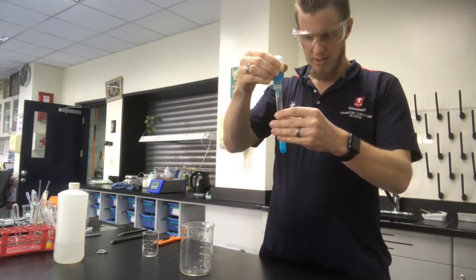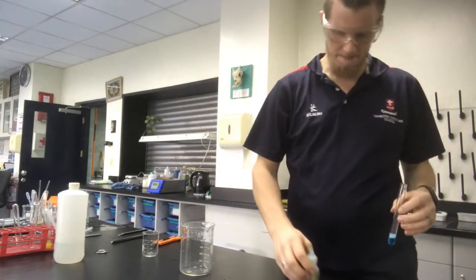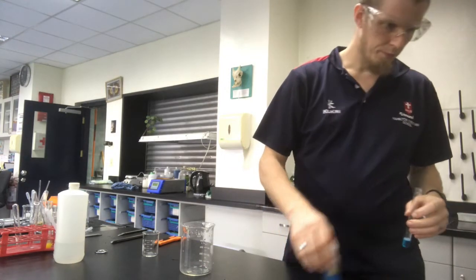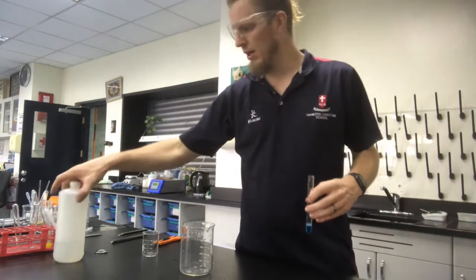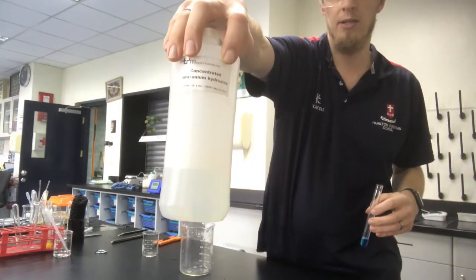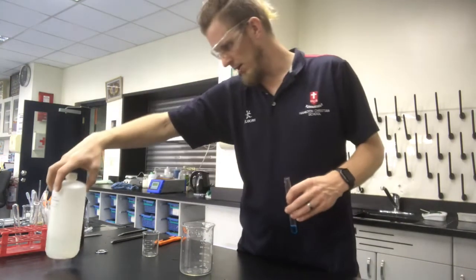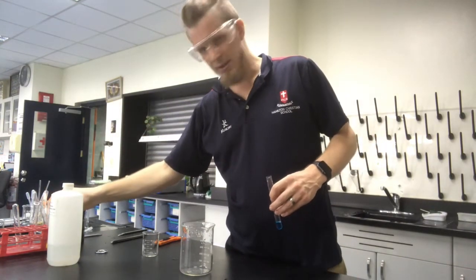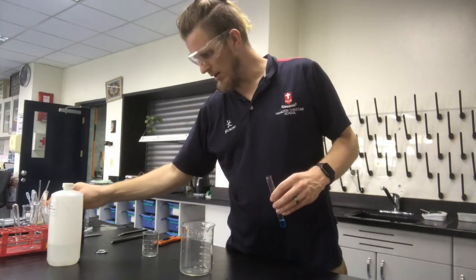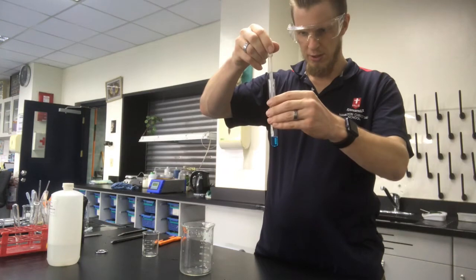I'm going to drop some of that into my test tube. Now what I've got here is some concentrated ammonium hydroxide. It smells like toilet cleaner, because ammonium hydroxide is essentially toilet cleaner. So I'm going to take that, and I'm just going to put a little bit to start off with in my test tube.